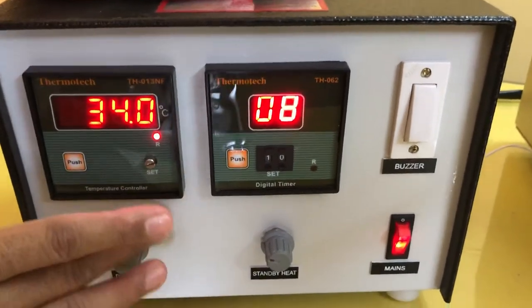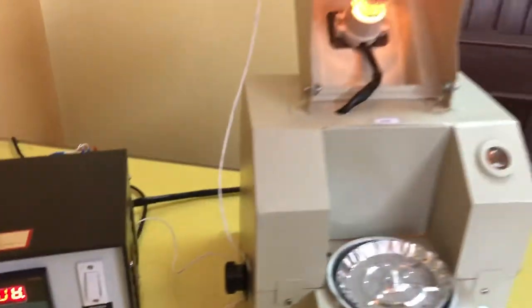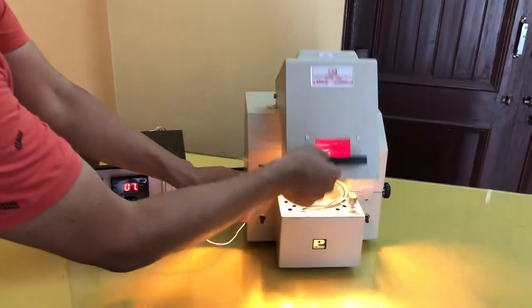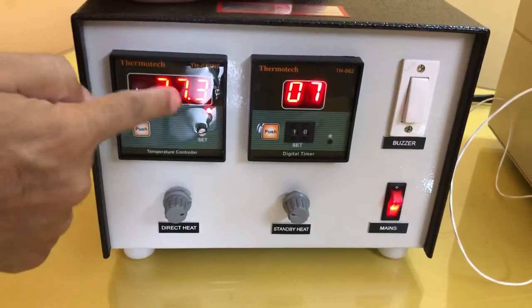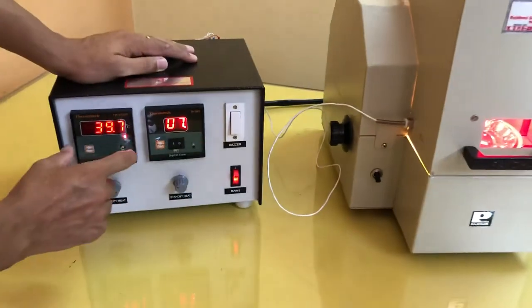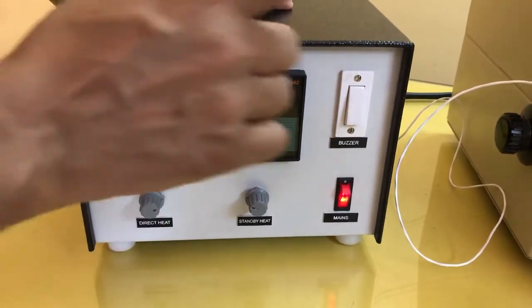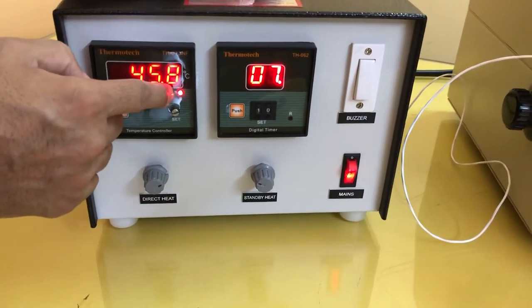What this temperature controller will do — till the temperature is reached, suppose I turn it on, now you can see this bulb is on. This is a temperature sensor. As I close this compartment, you can see this temperature is increasing. Till 110 degrees temperature is reached, this indicator light shows that current is given to the bulb. The bulb intensity can be controlled with this knob. Once it has reached 110, this will cut off supply to the bulb and this light will go off. This small light directly indicates the condition of your infrared bulb.